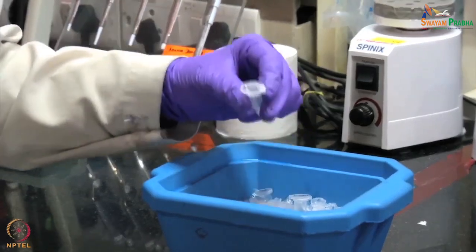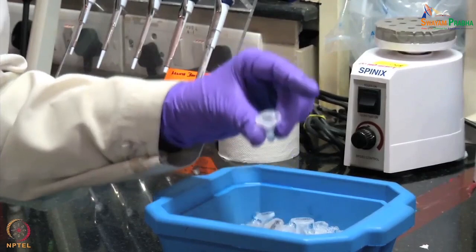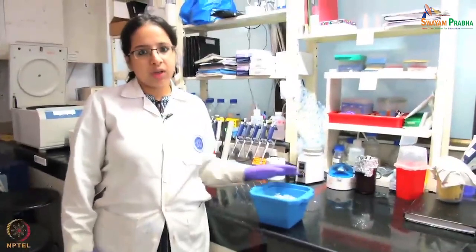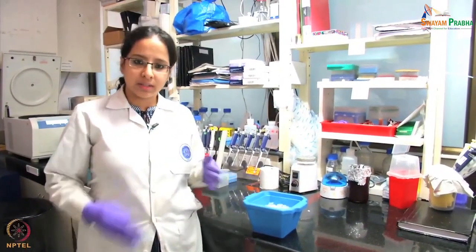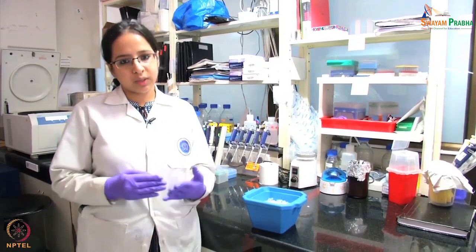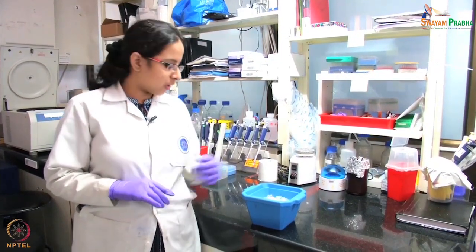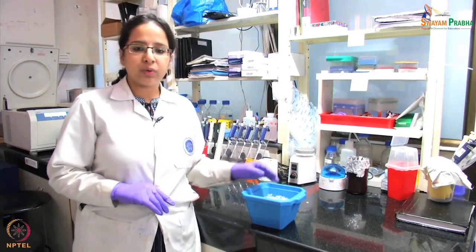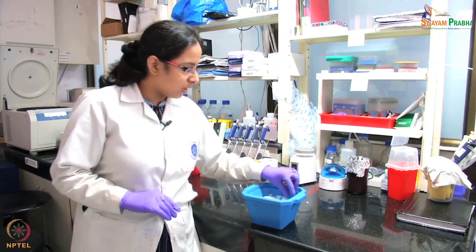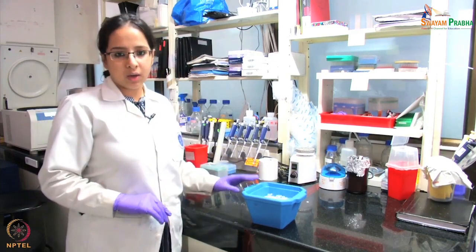In order to introduce the insert into the vector, let us begin the experiment. We have taken our vector DNA and also our insert DNA. What we are going to do is treat them with restriction enzymes. Restriction enzymes will cut these DNAs and create compatible ends so that the insert and the vector can join and form a perfectly circular structure. We are going to carry out restriction digestion separately for insert and vector. First we take our vector.